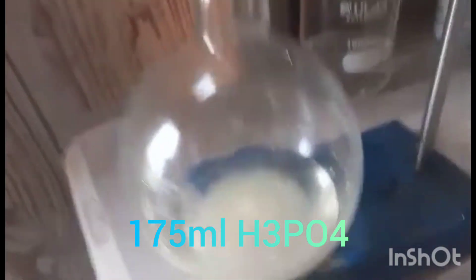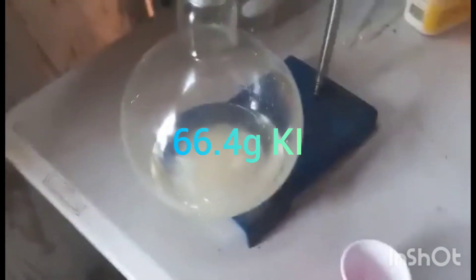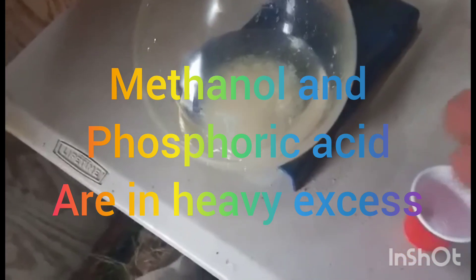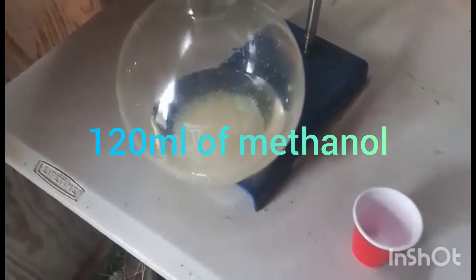So we have 175 mils of H3PO4 and 66.4 grams of KI — phosphoric acid and potassium iodide, respectively. This is going to create hydroiodic acid as the intermediate; I'm not looking to isolate that. I want to isolate methyl iodide, so we're going to be using 120 milliliters of methanol here.